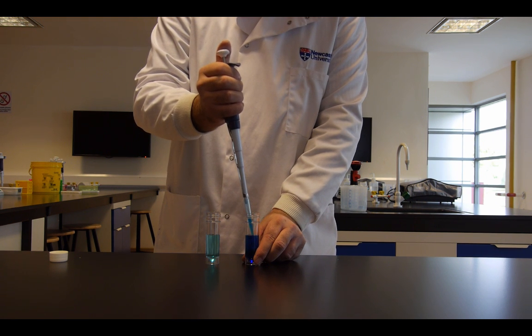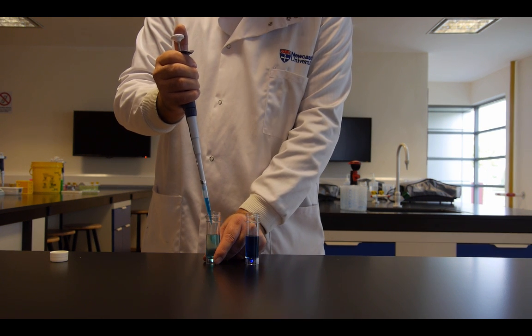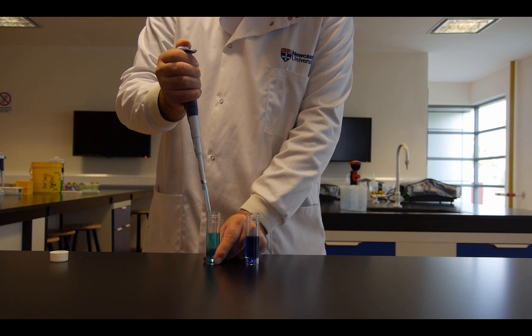Again, draw up the liquid slowly having pushed the plunger to the first stop, over to the other container, push down to the first stop, pause.